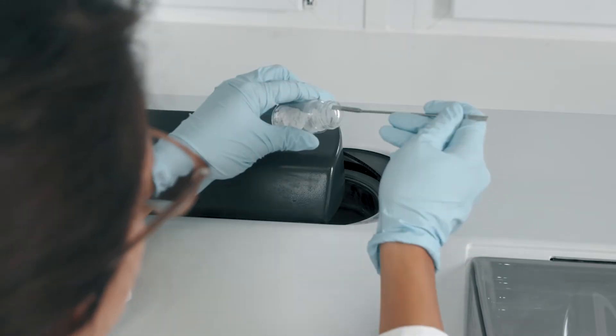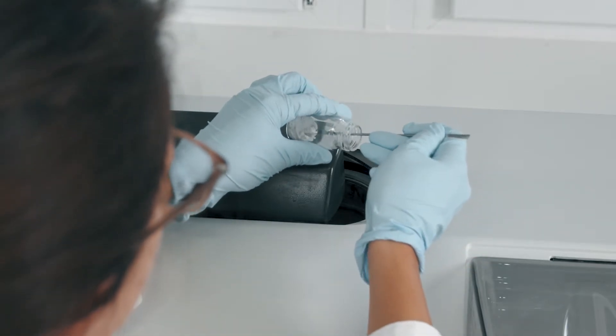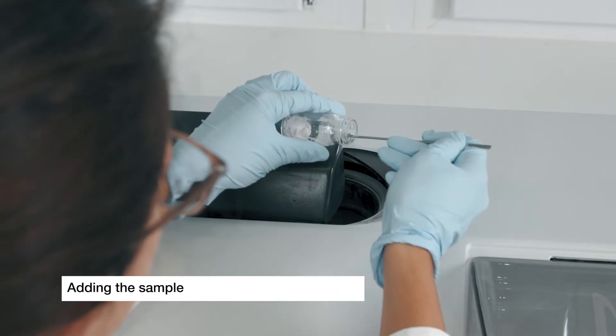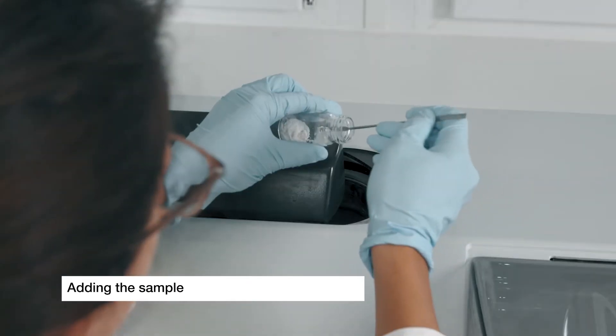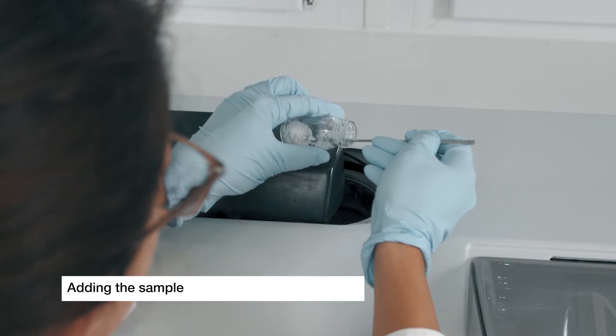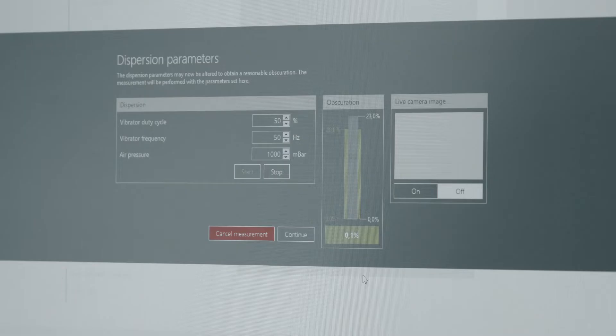After the background has been recorded, the user is asked to introduce the sample into the main sample tank. The sample is added little by little until the desired concentration has been achieved. This is clearly indicated by the software.